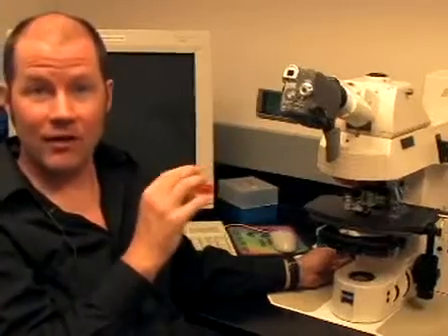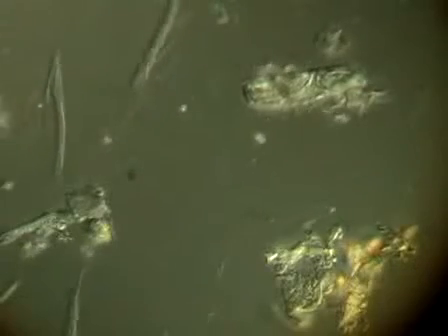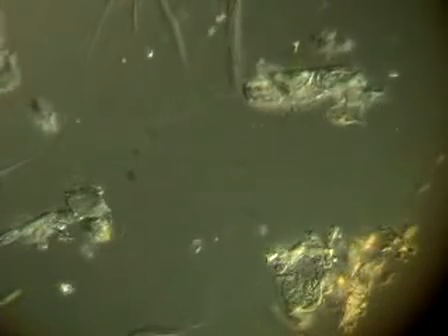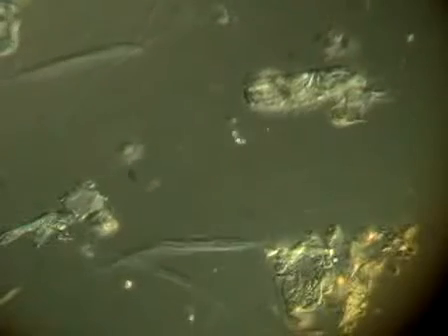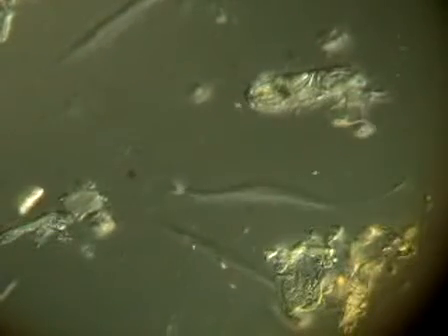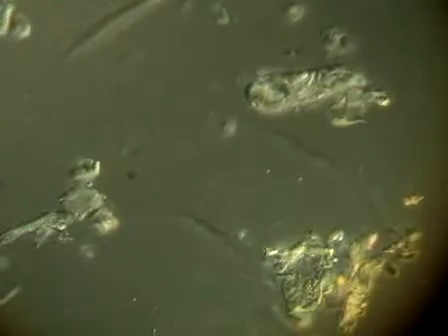So this is an example of what's nice to look at. It's inspiring in the sense that it tells me there are a lot of these protozoans in here. We can look at the phylogeny of the host and the cells. We know what the protozoan is, and we know what the species are that attach to it, but we don't know what either the protozoan or those bacteria do. What is their physiology? What do they eat? What do they make? How do they interact with the other microbes? How do these products impact the other microbes or the host? So we functionally don't know where they fit into the puzzle.